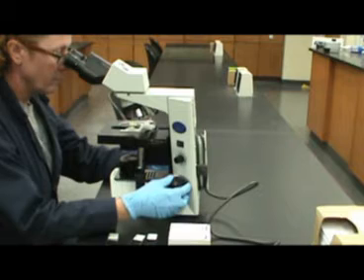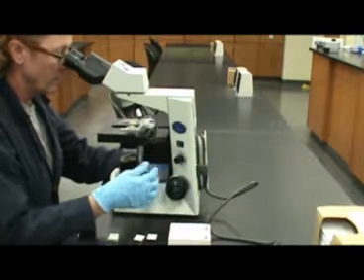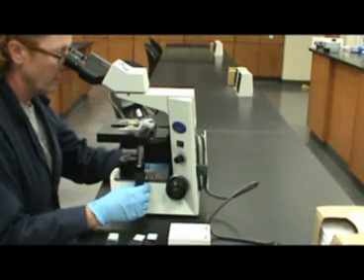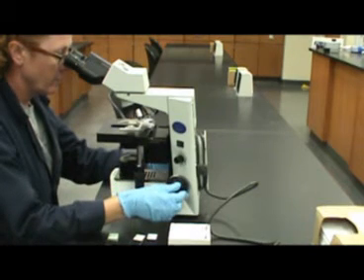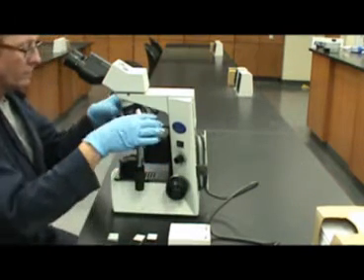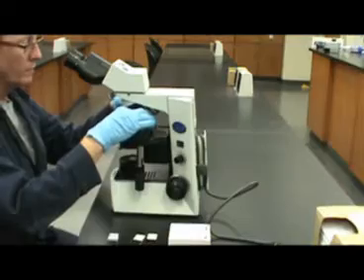The first objective used is the low power objective or 4x objective for this microscope. With the 4x objective, use first the coarse focus to move the stage up so your specimen will be in focus. Here, the coarse focus knob is being used first.